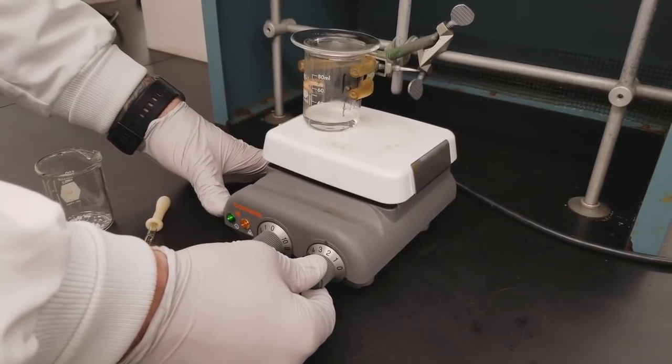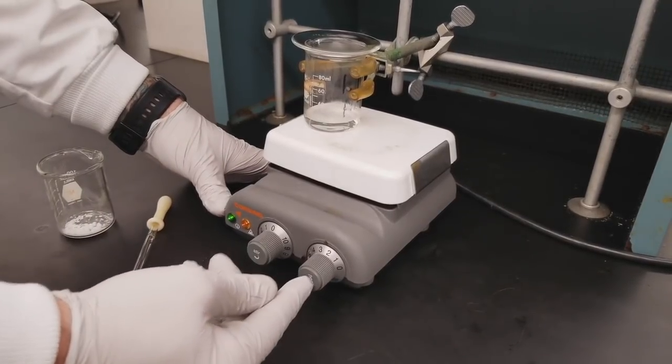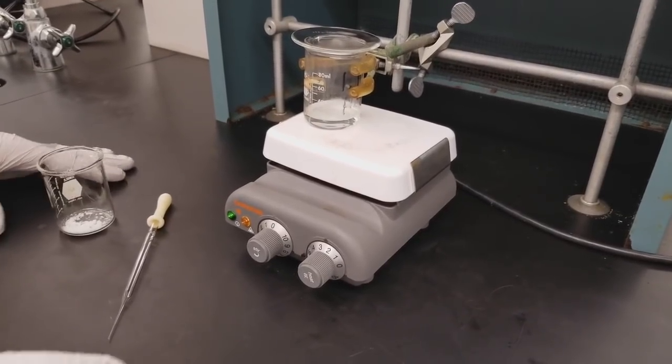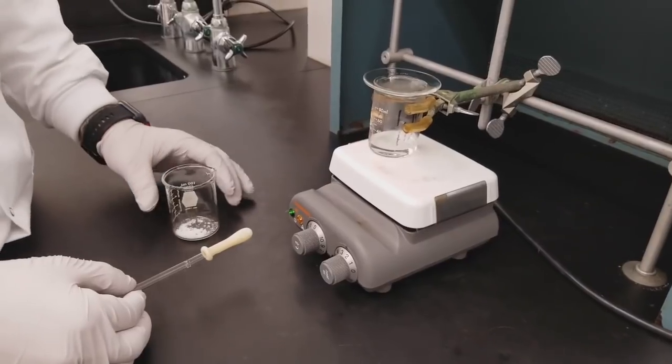We want to turn the hot plate on to a very low setting. We are using ethanol in this particular recrystallization, so between two and three will do just fine.